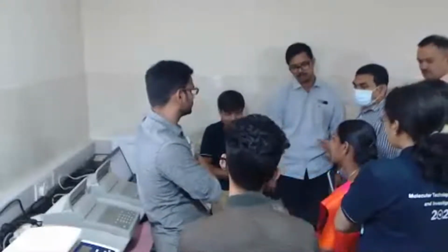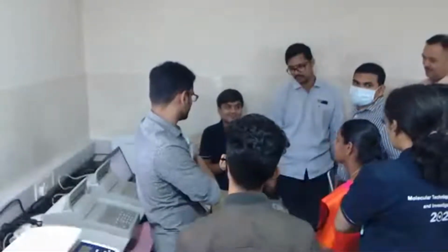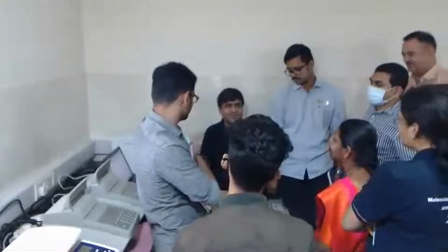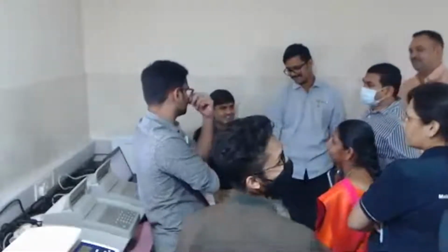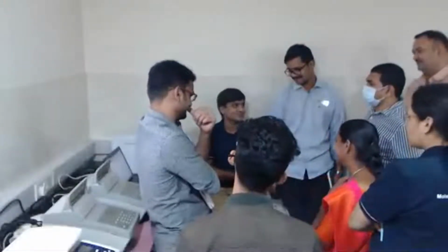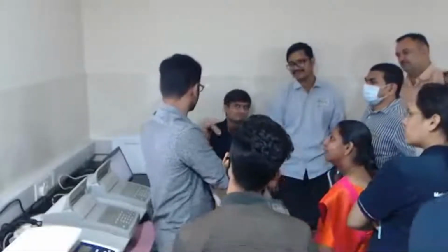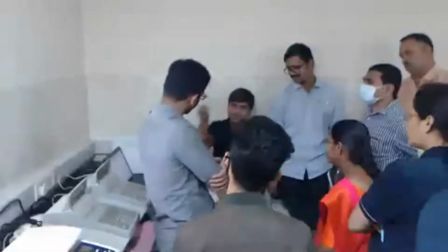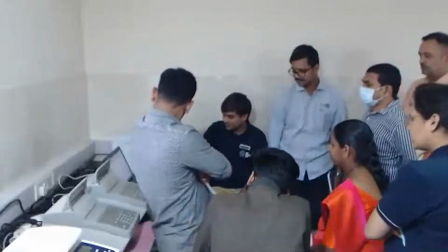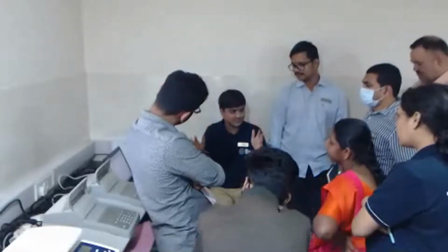No, never. Multiple amplicons can have the same size. Therefore, we are doing sequencing and not looking only at the bioanalyzer. But in whole genome sequencing, it will be like 16S, a single broad peak. I'll show you. Now, all of them are having different sizes but in a similar range.